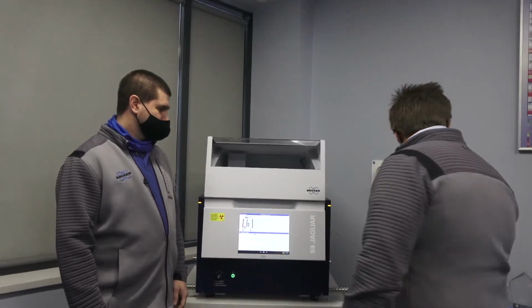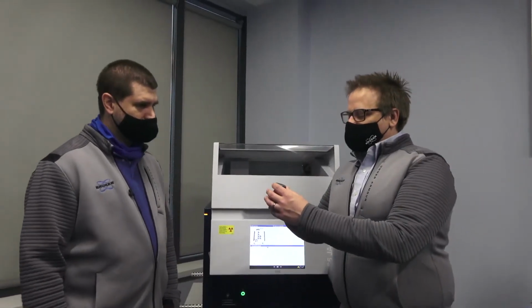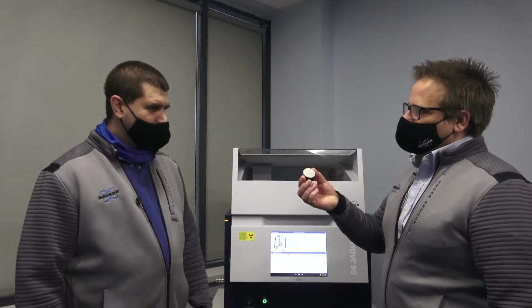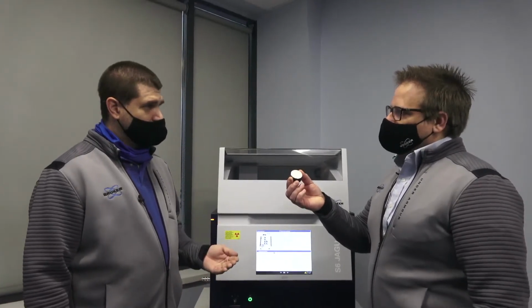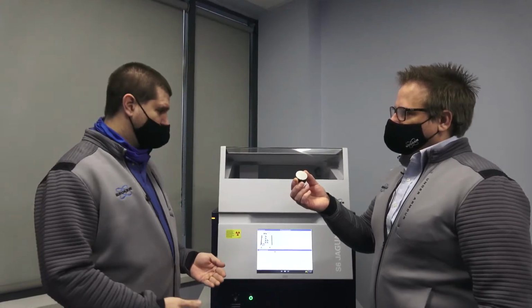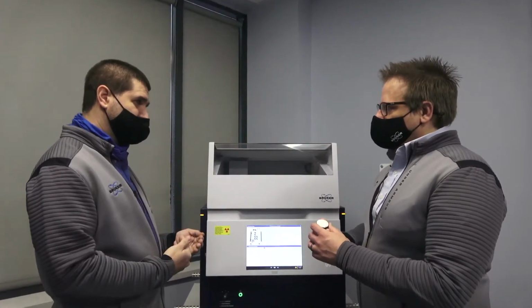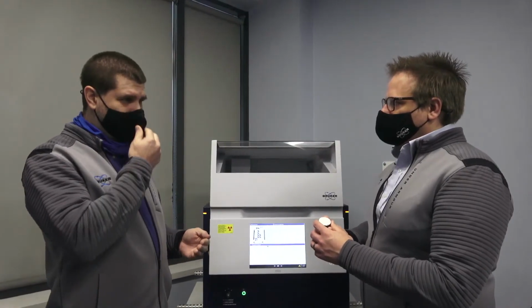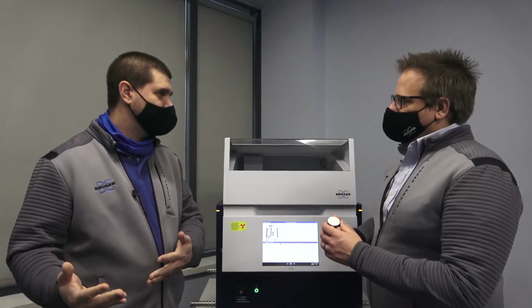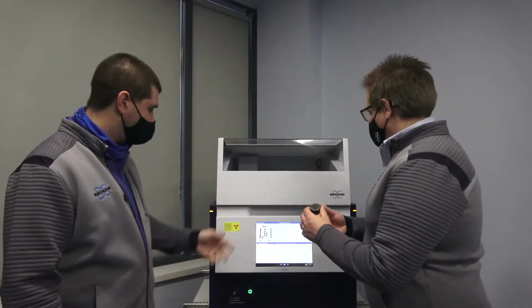Okay, so it looks like we actually have a steel sample right here. If I was a steel customer, what would I be interested in about this sample? If you're running that sample, you're looking at the elements that are present and how much of each element is present. As an operator, you basically just put it into the system, press a button, and you get results. The method development that's done beforehand is usually done by the expert user or by an application scientist that comes on site beforehand. Would you care to take a shot at it and run it for us? Sure. Yeah, so what do we do?